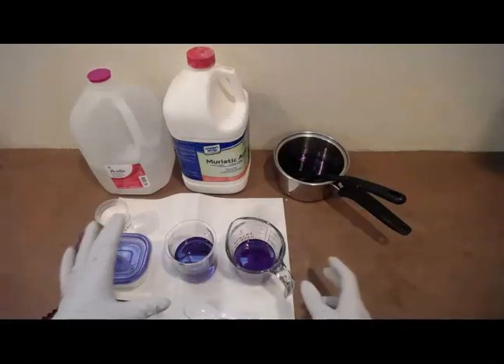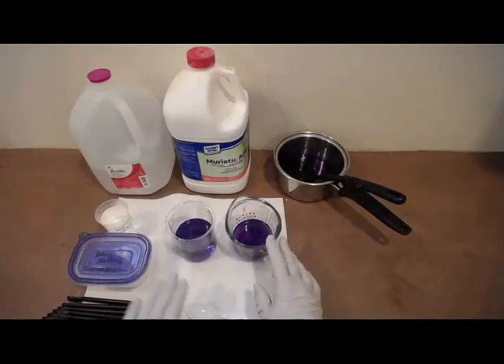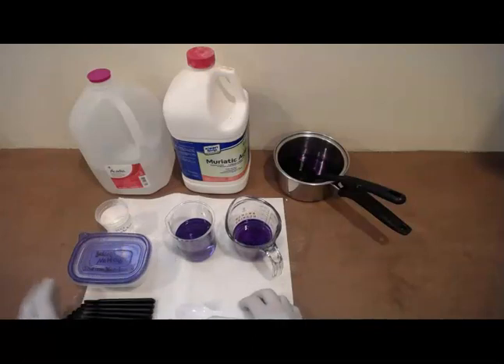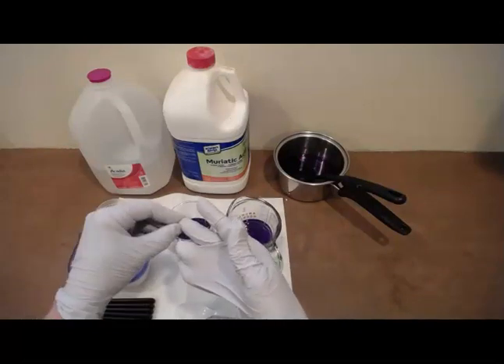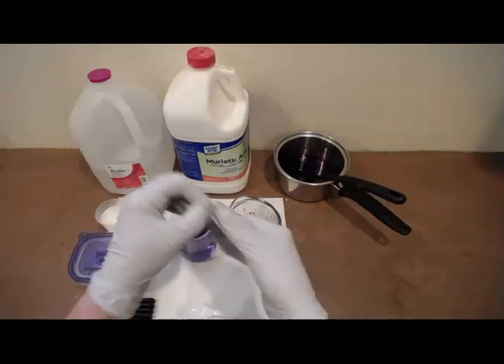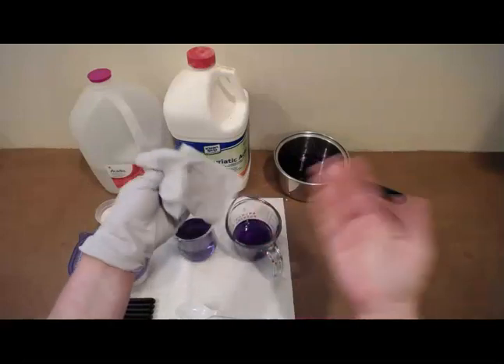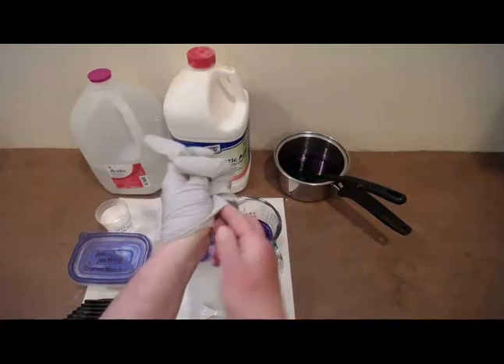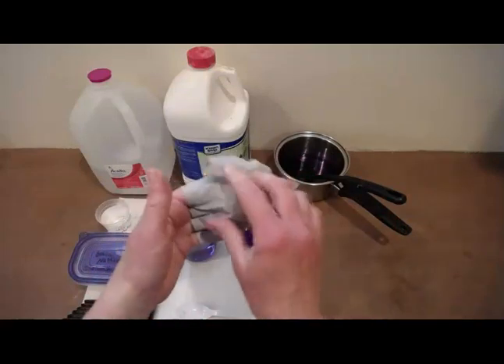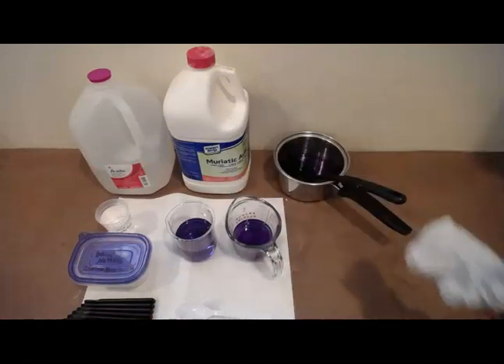Again, when you clean up, do make sure you're wearing your eye protection as well as your gloves, and pour those down the sink and rinse them down with plenty of water. And when you're done with your cleanup procedure, then it is time to safely remove your gloves. And again, you do so by grabbing the dirty part, a contaminated part of the glove, with your other gloved hand. And now you have a clean hand and you're going to reach underneath the other contaminated glove and pull it over like that. And then you have a safe surface to be touching, and then you'll discard those in the trash.